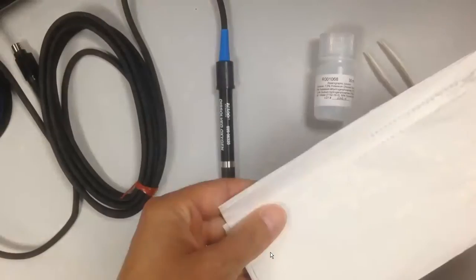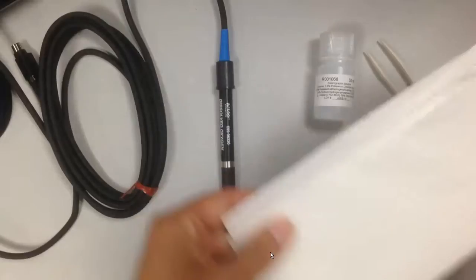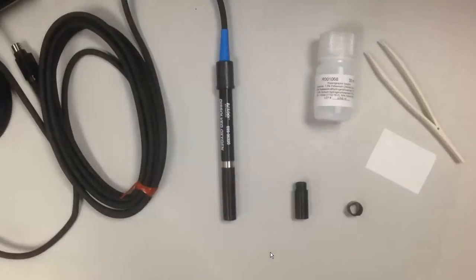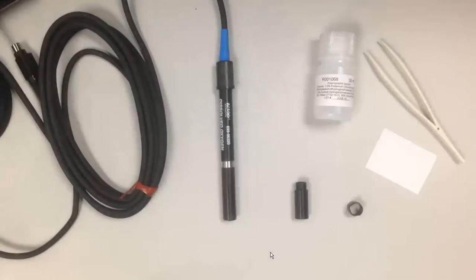So the first step we'll have is we'll also have to have the paper towels to take up any spills that might happen.